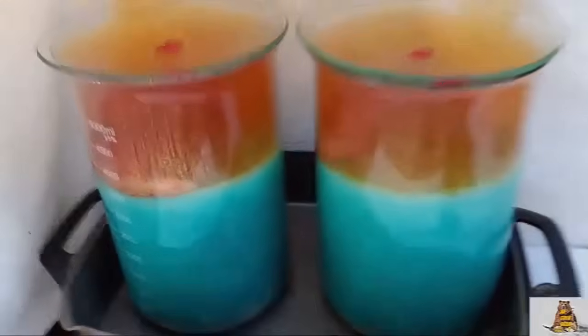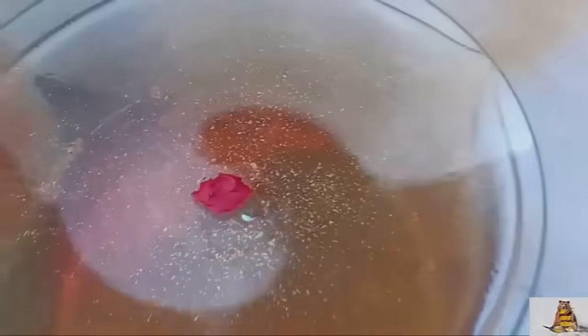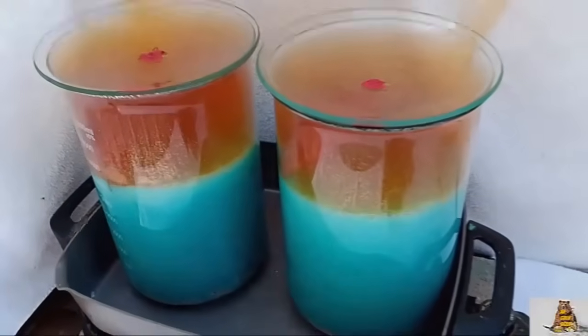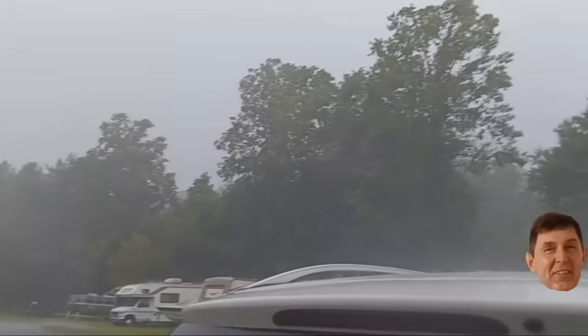Copper is dissolving very well. There are some gold flakes on the glass, and even the lid has gold flakes on it. It's very important to use the lids or the gold flakes will fly away. Great weather for making copper sulfate — I can dissolve metals and take a fresh shower at the same time.